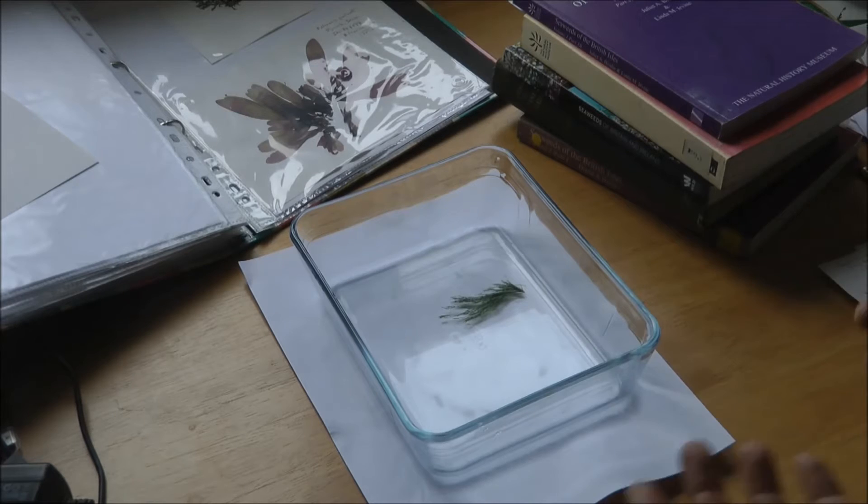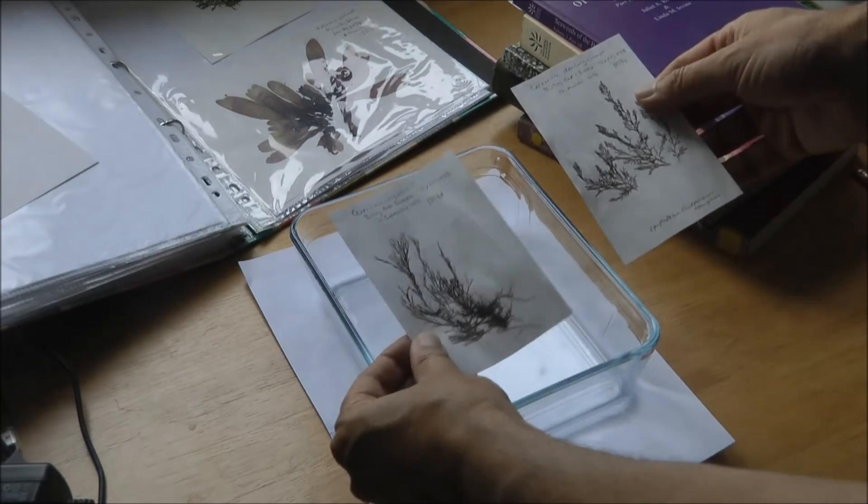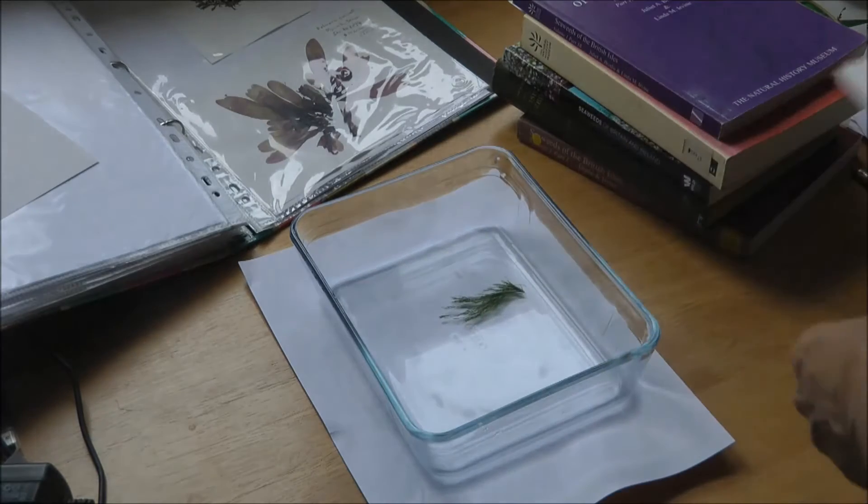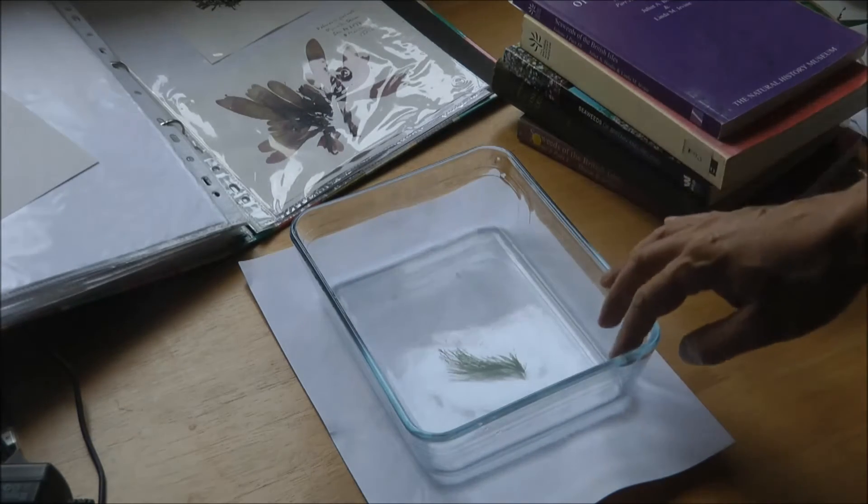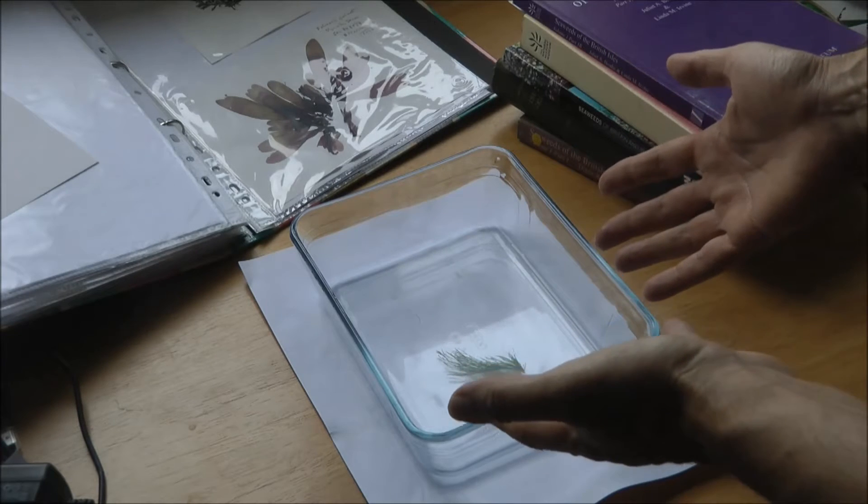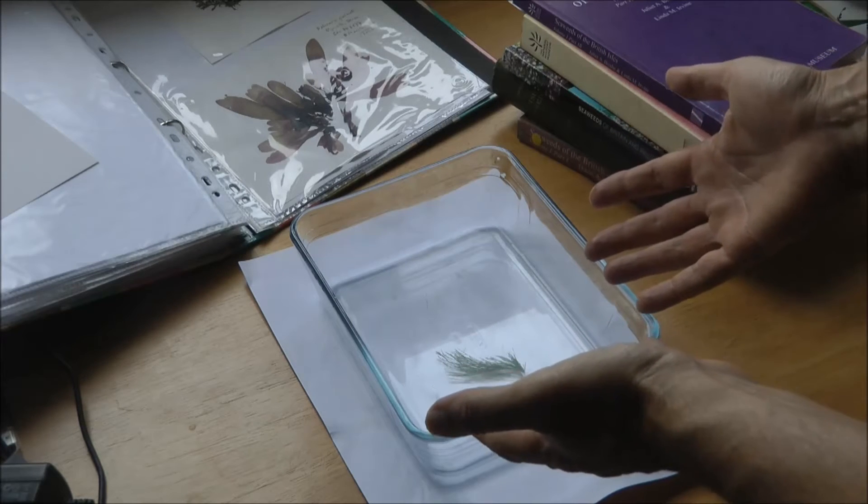Right, this is a quick illustration of how to press seaweeds so you can end up with some nice samples that look like this. Okay, we've got a seaweed here. Ideally it should be in seawater which you brought back with your specimen.